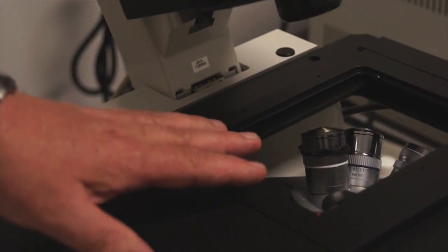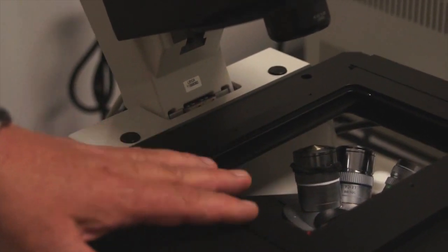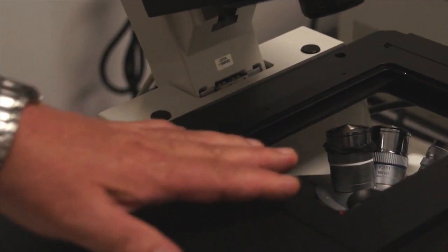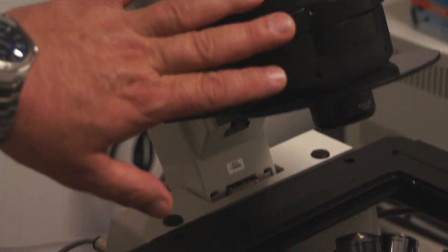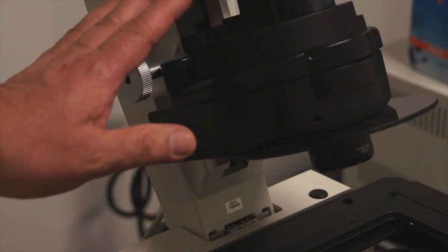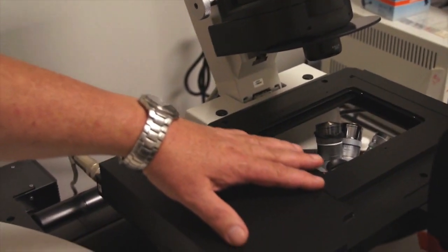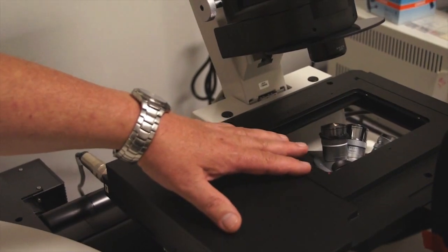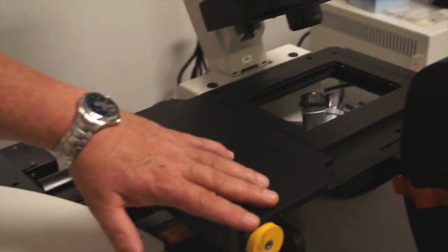The mechanical stage on the Leica microscope is motorized. There are motors that drive this stage in X and Y. And so that's another important reason why the condenser has to be rocked out of the way because when you initialize the microscope, the computer will drive the stage in X and Y to its end point because of the motors that are on each axis of the stage.